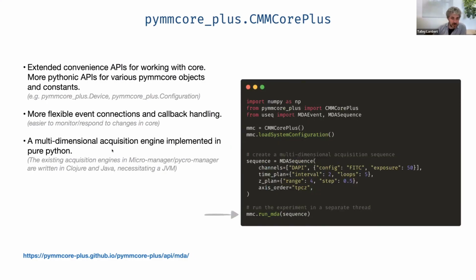Now, as I said, there's also a multi-dimensional acquisition engine. The way this works is with this run MDA method. I will talk about this object more in a bit. This is from useq-schema, one of the four libraries I'm mentioning today. For now, I will just mention that it is a declarative way to define a sequence of events. So it looks obvious here. I'm setting up a sequence with a couple channels. In one of them, I'm customizing the exposure, and the other one, I'm just calling the channel. I've got a time plan where I'd like to take 5 loops with an interval of 2 seconds, and so you get the point, right?